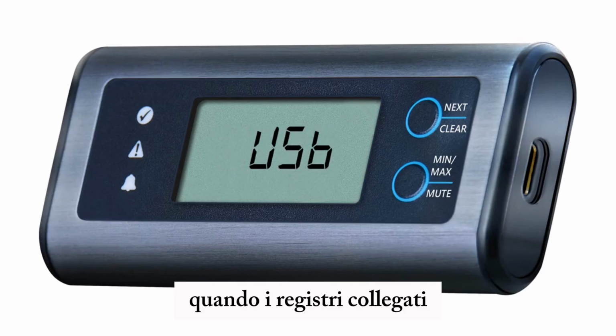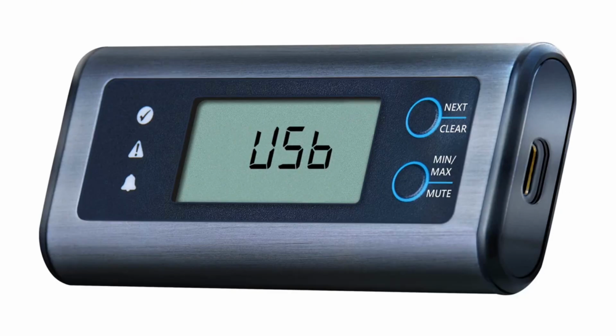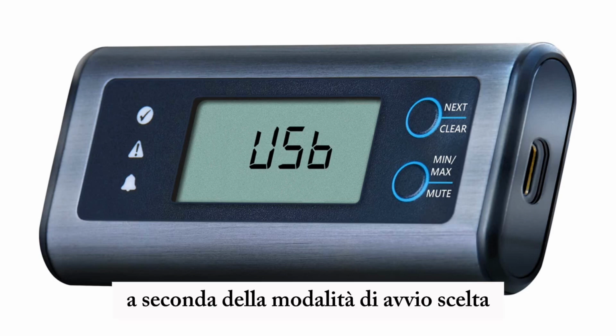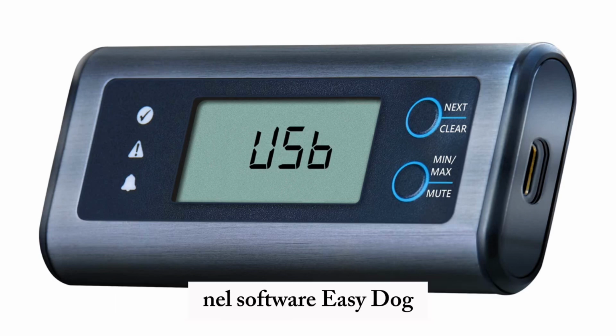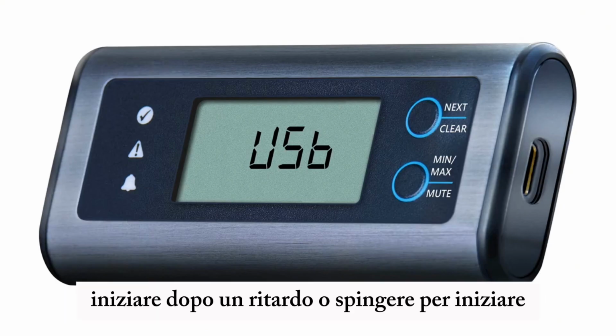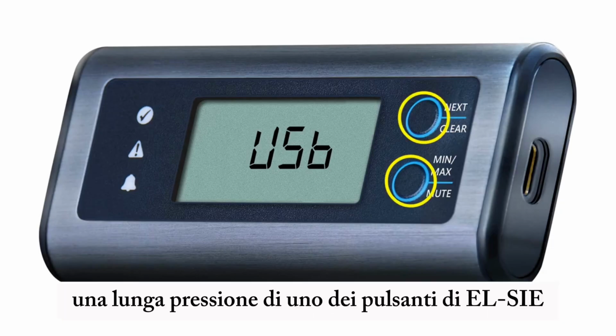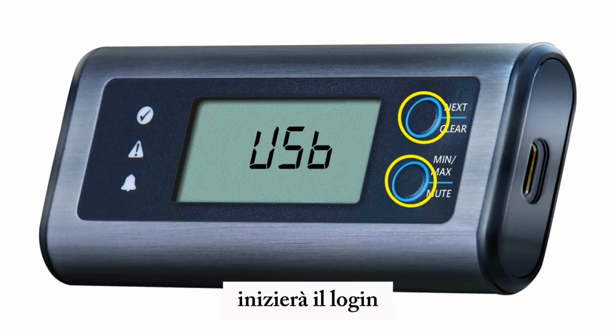When the log's connected, the phrase USB is visible in the EL-SIE's LCD screen. Depending on what start mode you chose in the EasyLog software, the EL-SIE will either start recording automatically, start after a delay, or push to start. If you chose push to start, a long press of either of the EL-SIE's buttons will commence logging.